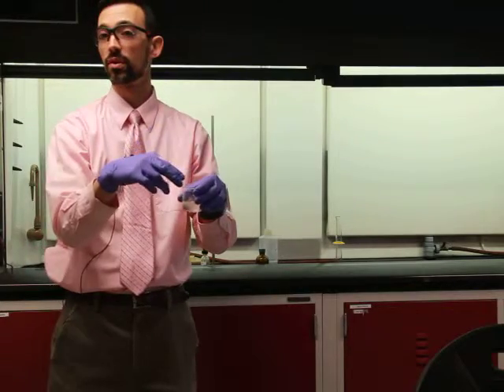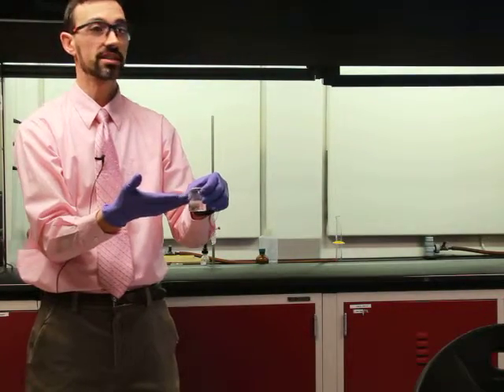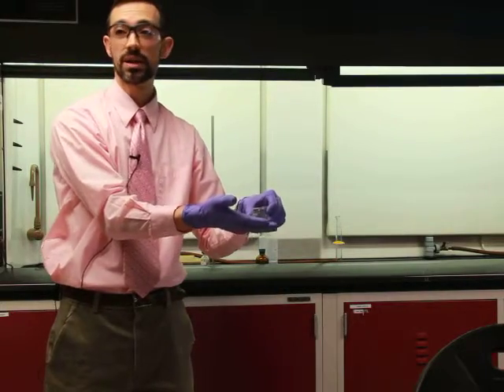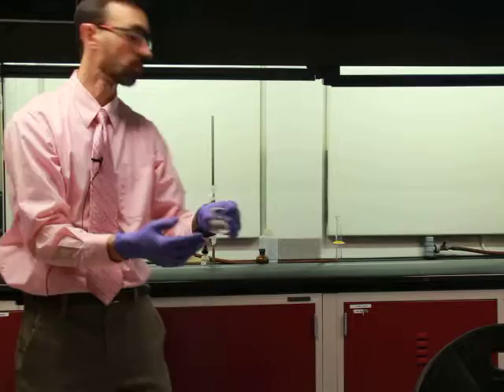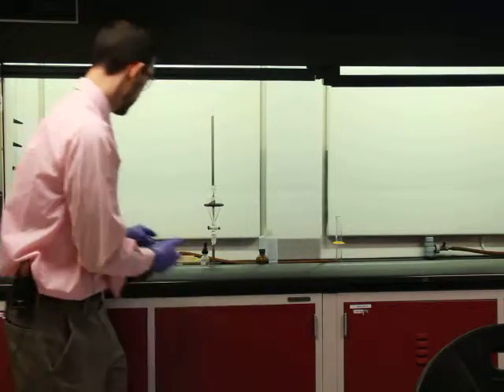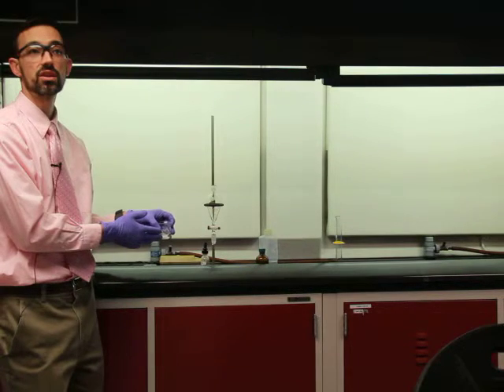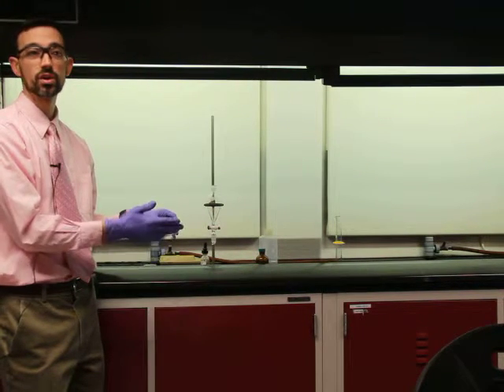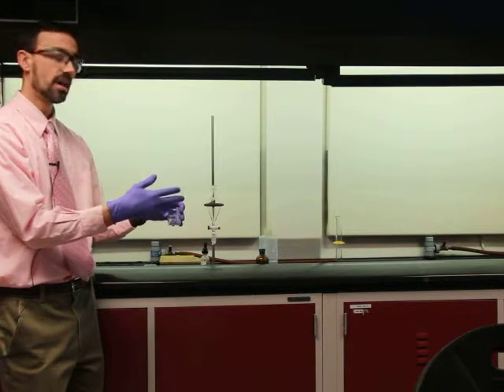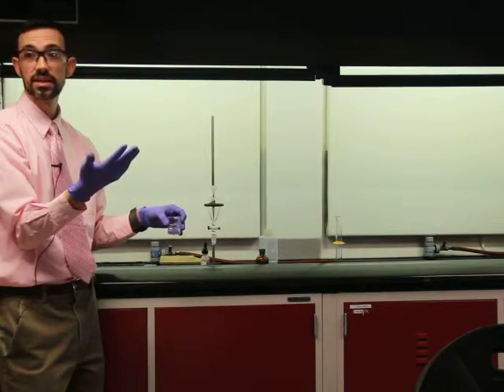Now we pour it through a Buchner funnel with a piece of filter paper in it, and the crystals of our acid are collected on the filter paper. The liquid then becomes waste that we don't want. Over here, for our ether and our neutral compound, we just let the ether evaporate. That takes like 20 minutes just sitting around with the hood on. This stuff has a very high vapor pressure, and so it evaporates very easily.